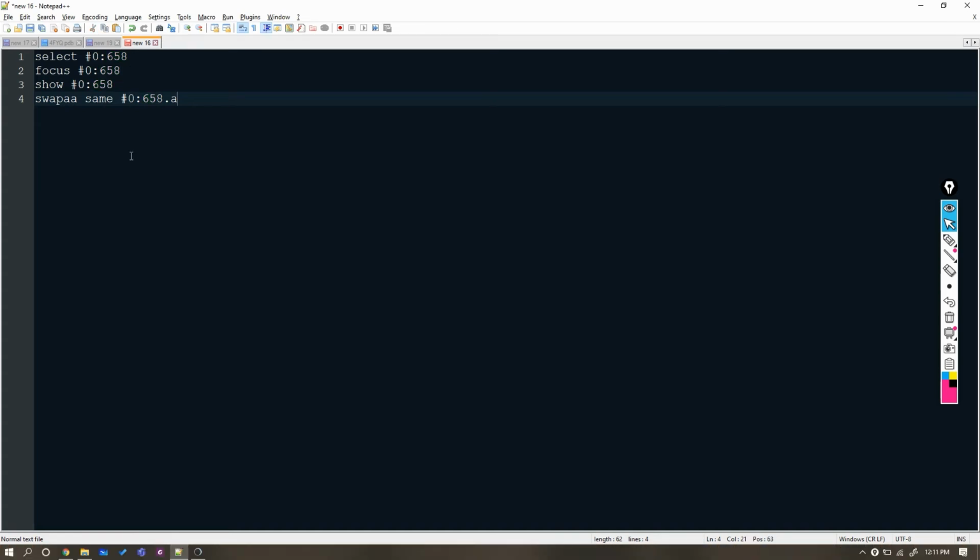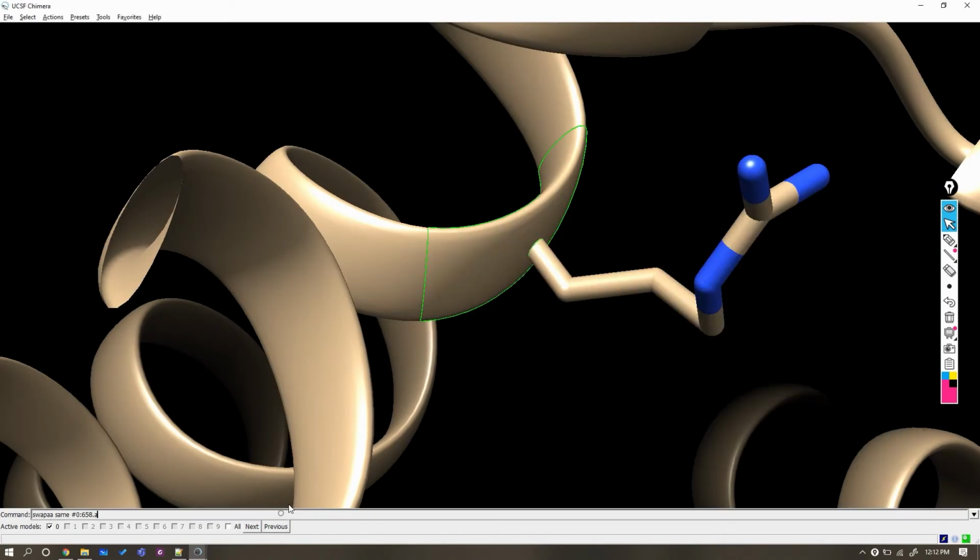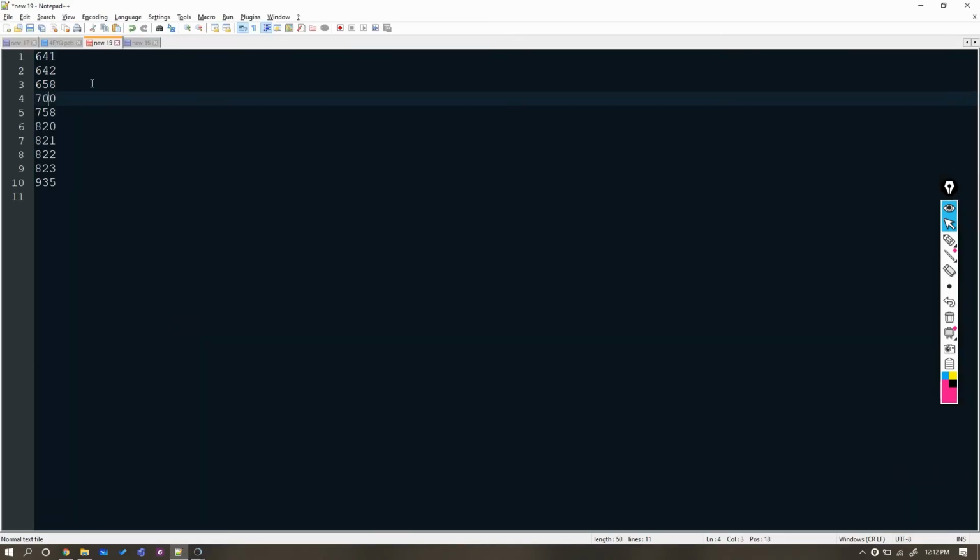We can use these commands repeatedly with a specific residue, and for this reason we have noted down the residues which were duplicated earlier in Notepad++. Open the window of Chimera. Let's close the sequence window as we do not need it now. Actually, I have done a practice on 658, so let's move to residue number 700.